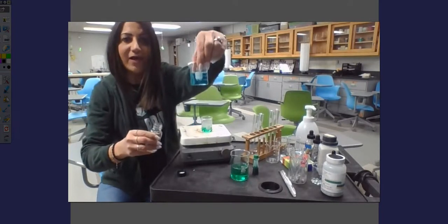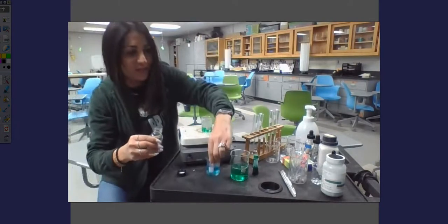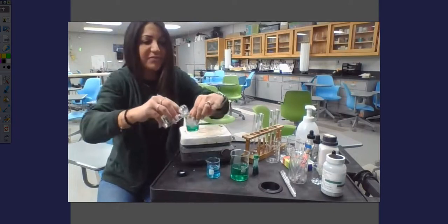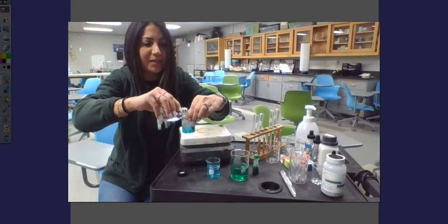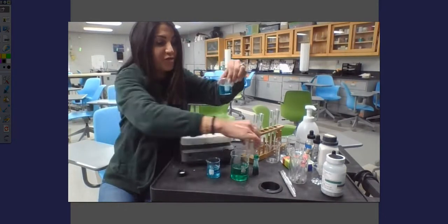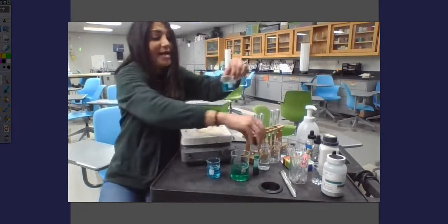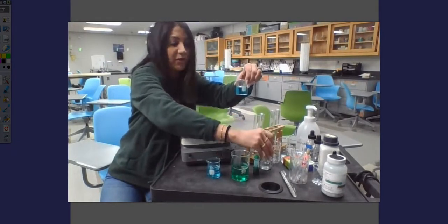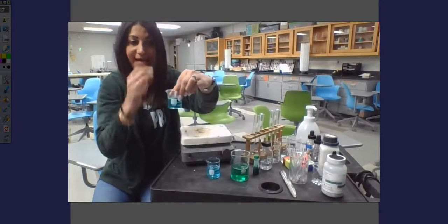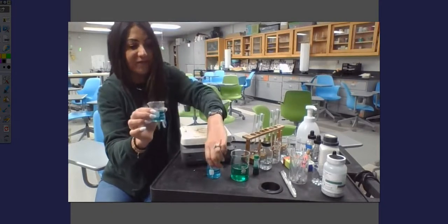Oh, I'm seeing something happen. We can see it turned this light blue color. Now I'm going to do the same thing, add just about 10 milliliters right into the hot one. And it's doing the same thing. But in order for this to be a good experiment, I only want to change one thing at a time. This is the hot one, and this one is cold.